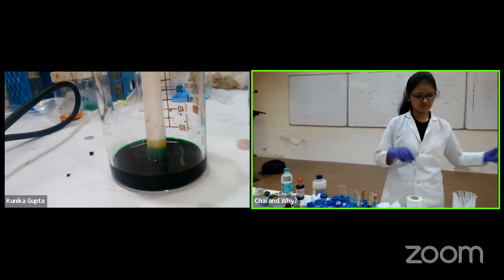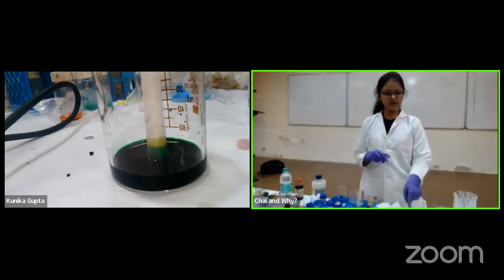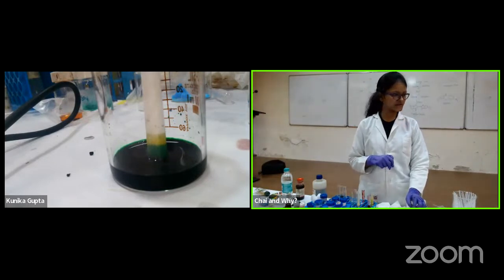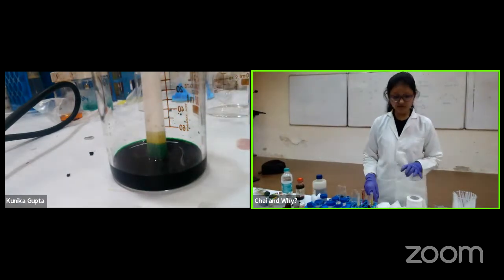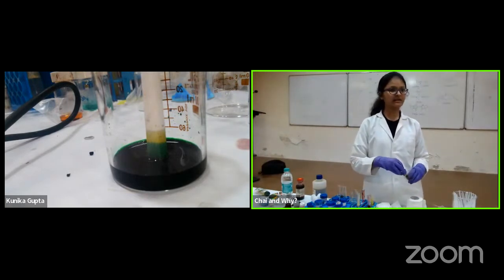I've turned this light on also, so now it's much better. So the yellow color is coming up. I think that is visible. Otherwise, once it is done, I'll pass the chalk to the audience here. And I think for the online audience, it's pretty clear that a yellow color is separating from the green one. Okay, so what I'll do is, this was pure green color. I have not added anything. Now I'll take red and green and mix them together.